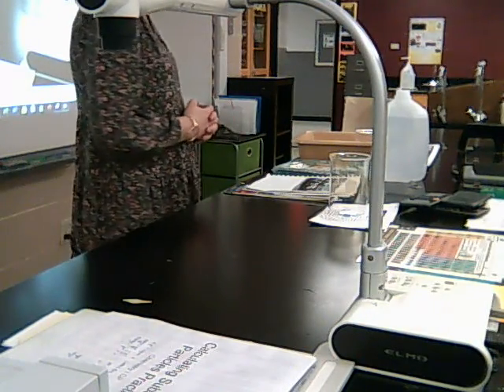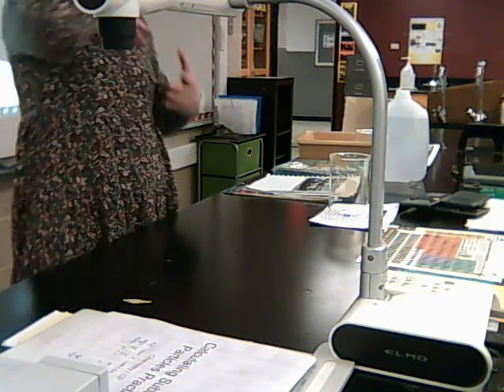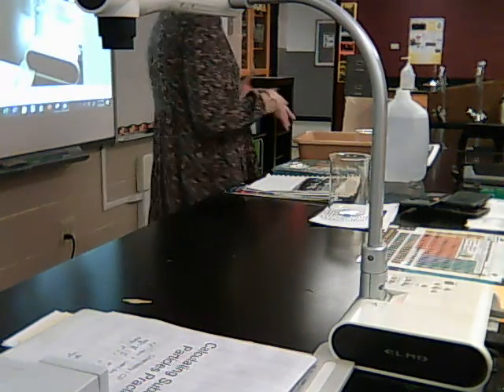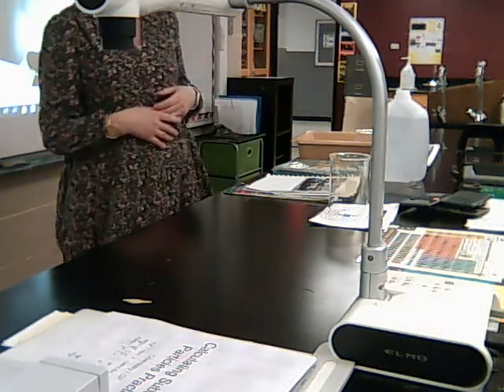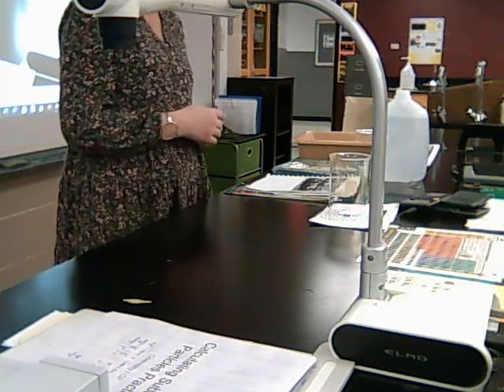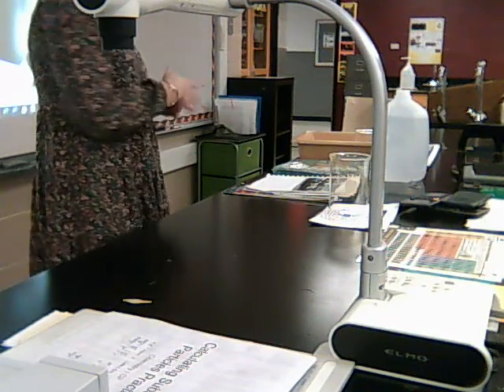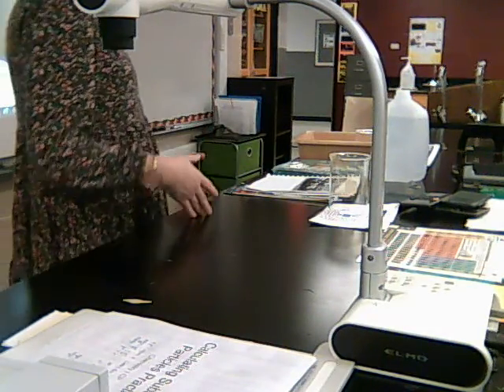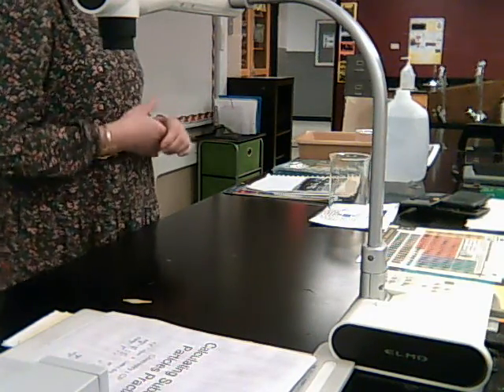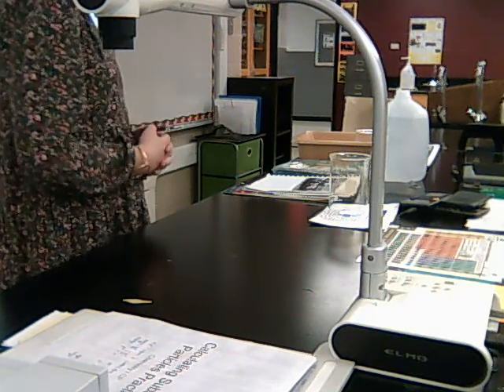Any questions about that? Okay. So then I just want you guys to talk to me about what you think. How do you think changing the surface area is going to affect the rate of the reaction? Remember we said when we cut it into little pieces, we're increasing the surface area. So when we increase the surface area, do you think it's going to make it go faster? Slower? What do you think? Faster.